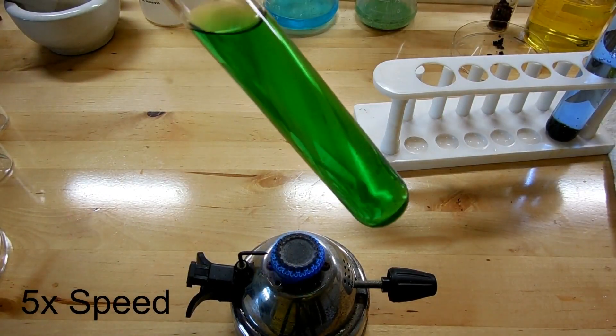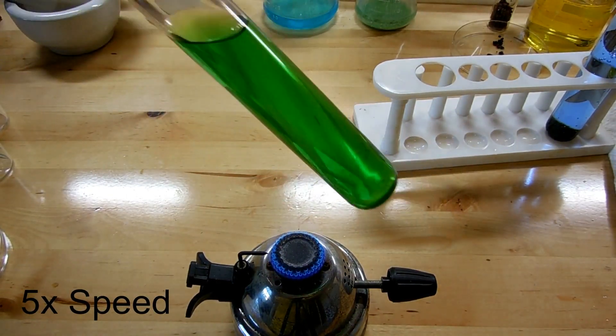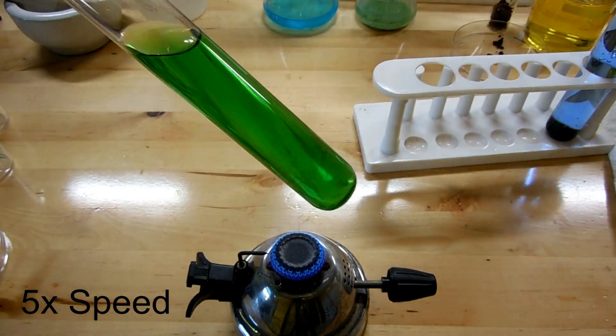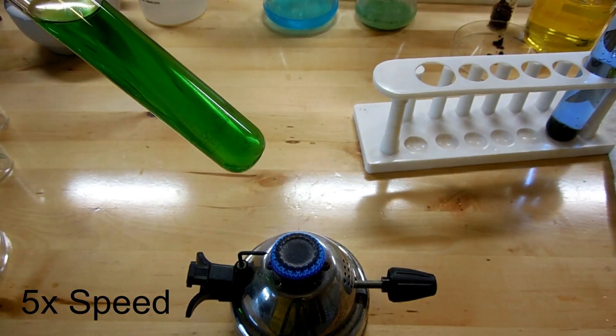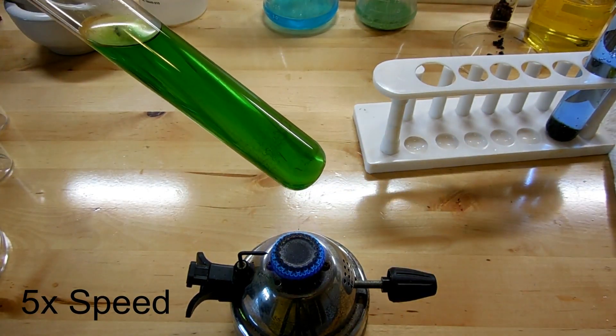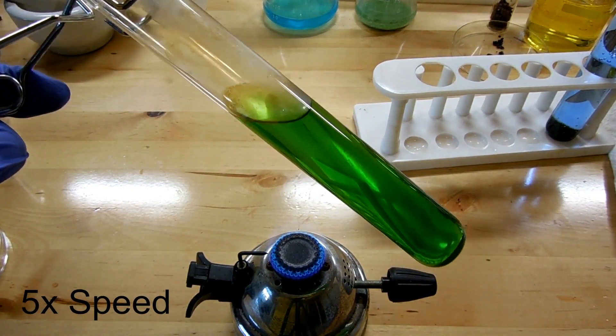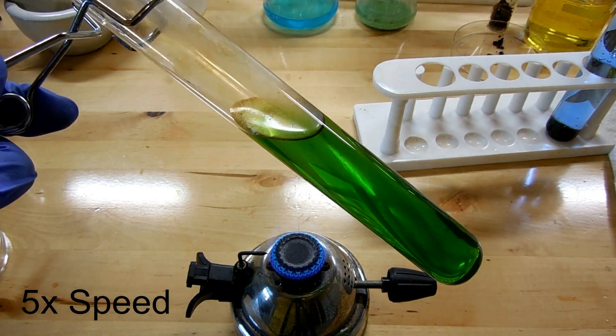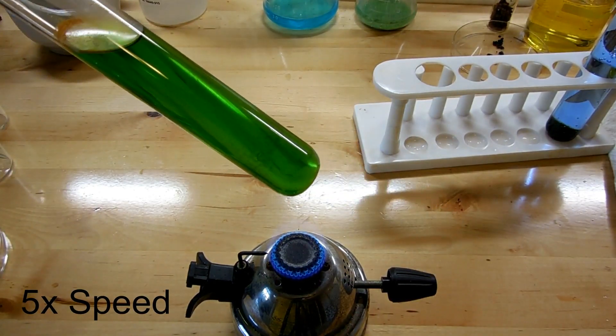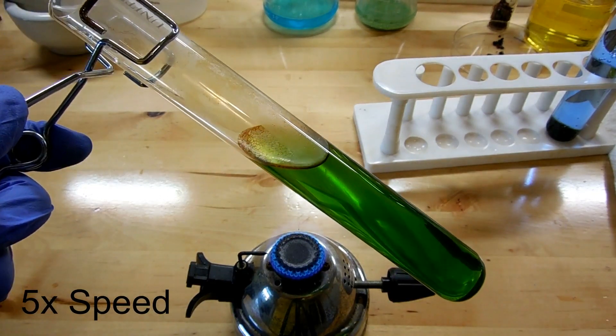Okay, I've got my butane burner here and we'll just hold the test tube over that while it heats. And the way to heat a test tube is to sort of move it in and out of the flame. You don't want to hold it in one place for too long, because then you can overheat the test tube and you can get a flash boil and it'll spray out the end of the test tube, which is not a good thing. And also you want to keep the mouth of the test tube pointed away from you and anyone else, again, just in case it splatters out of it.